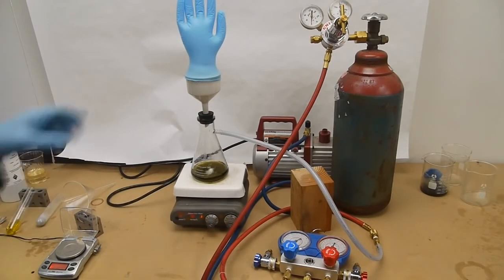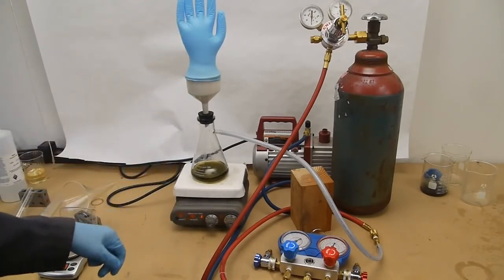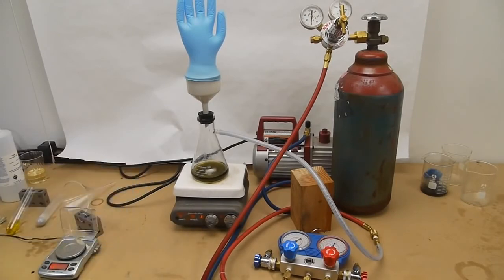So this last time I filled with hydrogen, and you can see the glove is inflated so there's a very low amount of pressure of the hydrogen gas in there. I'm just going to leave it stirring unheated for about one to two hours.